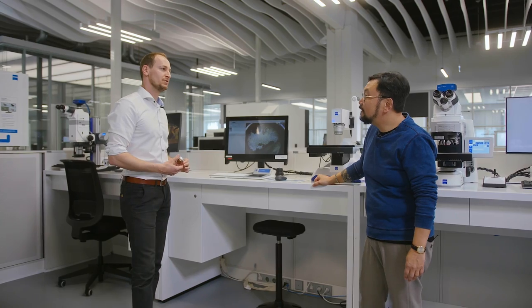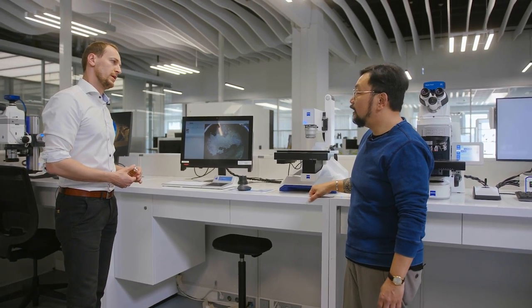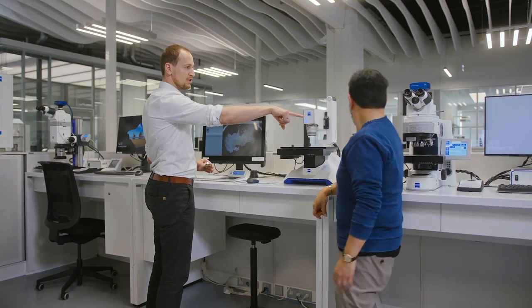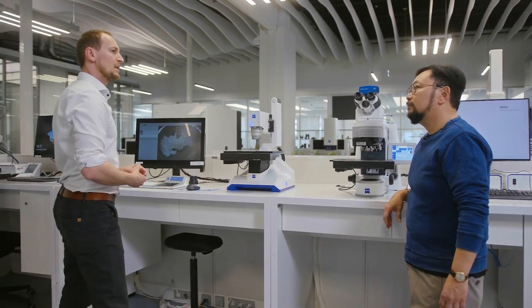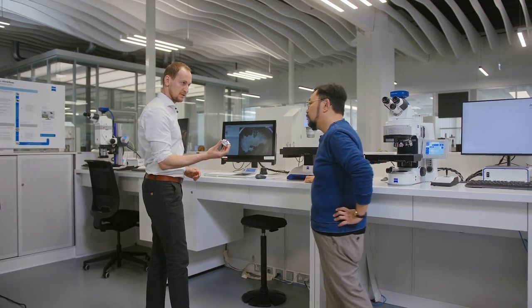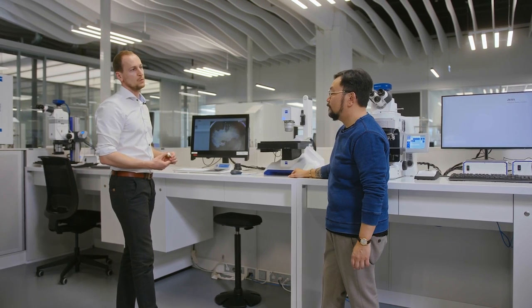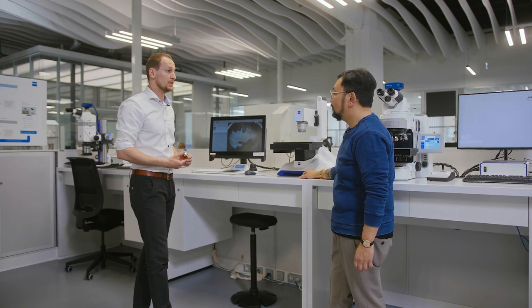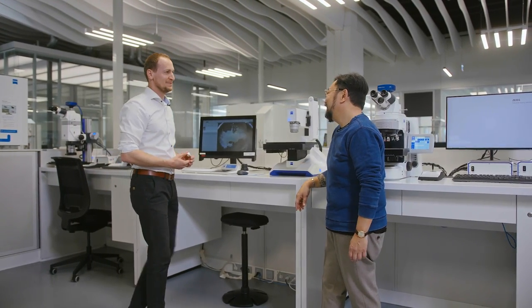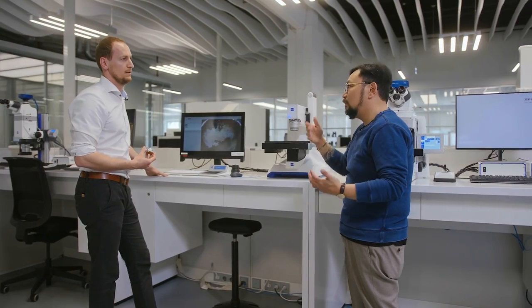So I'd say we start by talking about microscopy in general. We're standing here in front of a digital microscope — this is our Smart Zoom — and next to it is a compound light microscope. We've prepared a sample here, and on the screen you can see the surface of a fractured sample — a broken part. In failure analysis, the question is typically to find out why this sample broke, because someone always has to pay for it.